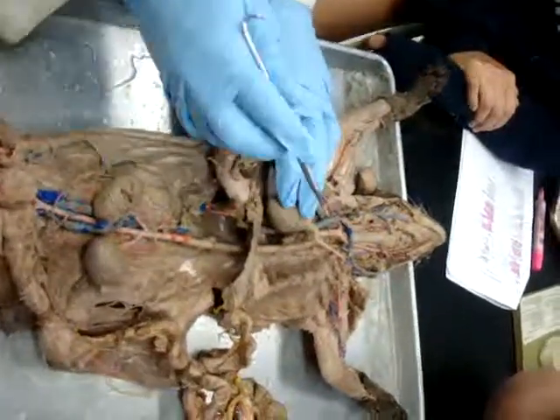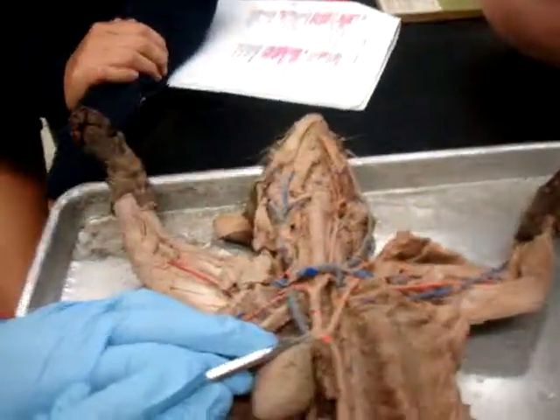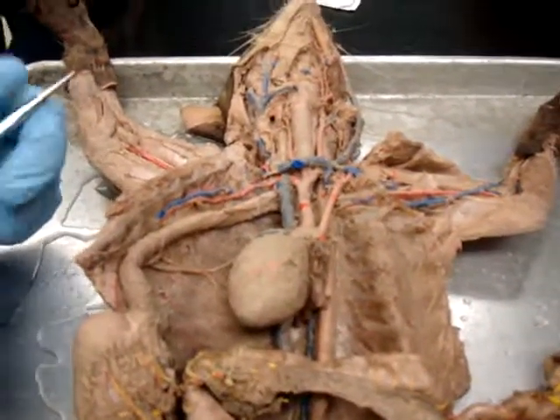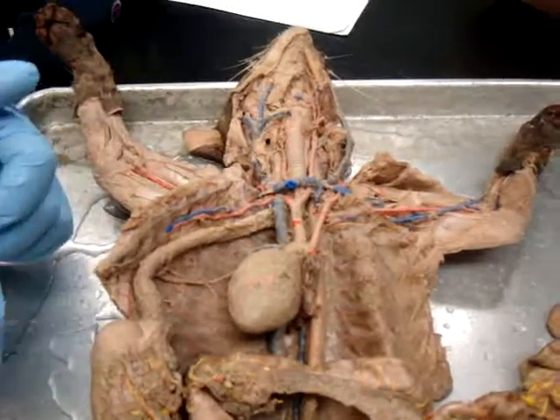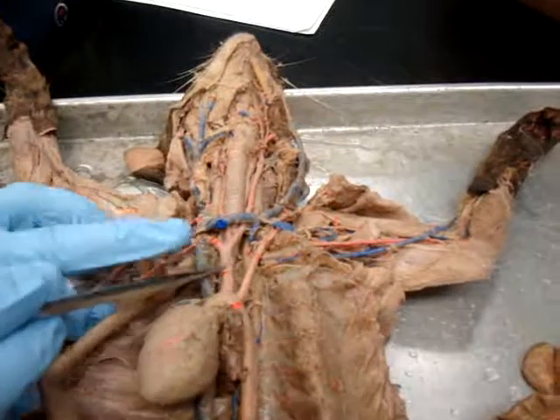Now, in the human, we expect to find 3 branches off the top of the aortic arch. In the cat, we're only looking for 2. Humans have the first major branch being brachiocephalic. In cats, it's actually called the innominate artery, but we're going to call it brachiocephalic in the cat anyway, simply because that makes it more relatable to humans. So you can call this cat brachiocephalic.